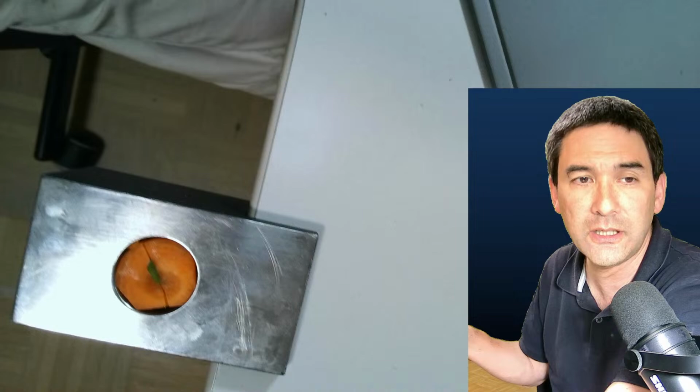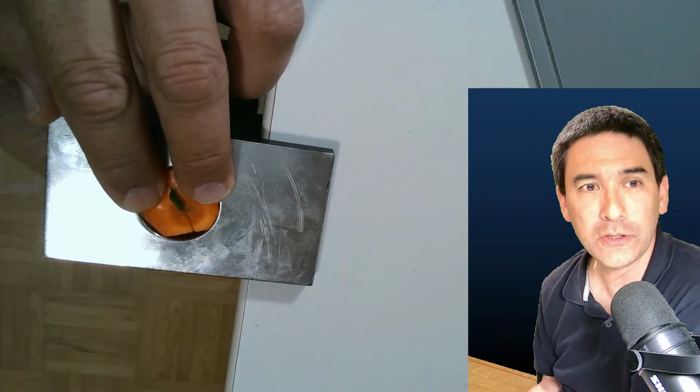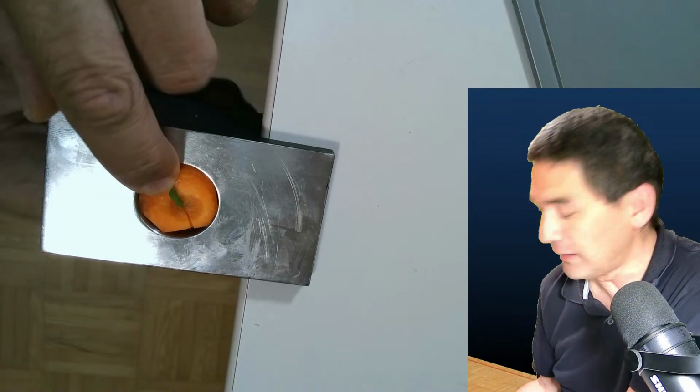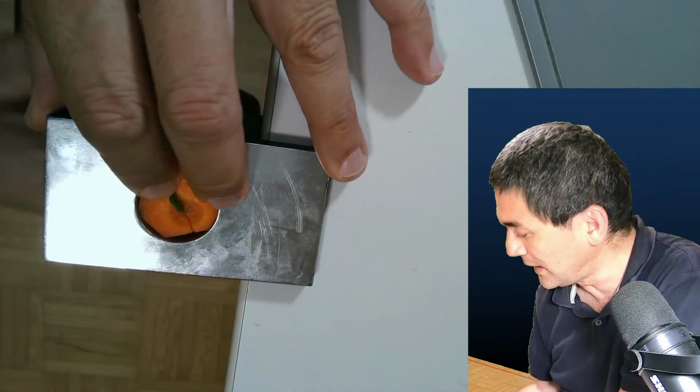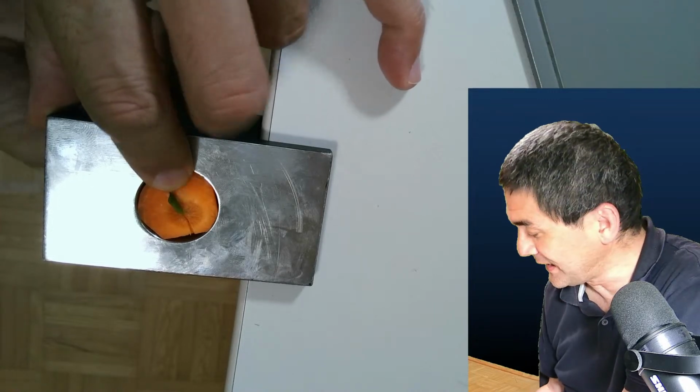How do I do this? Here we go. Here we go. The camera is tipping over. I have to add a little bit of weight. Just going to add my other microtome here. Okay, and now I'm going to turn the bottom. Oh, wrong direction. Okay, you have to turn it clockwise, and I kind of feel it advancing out.